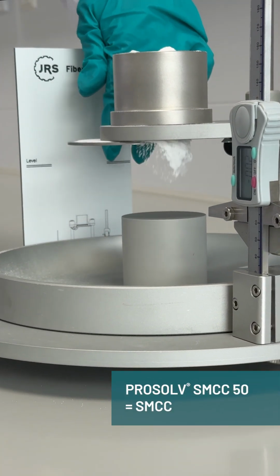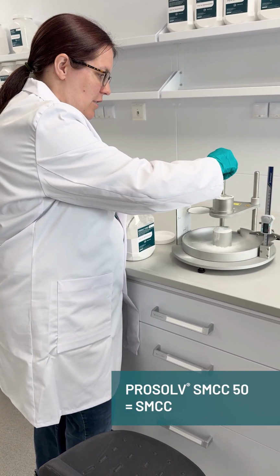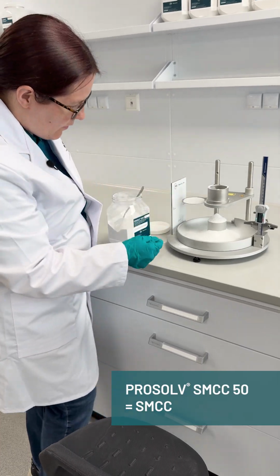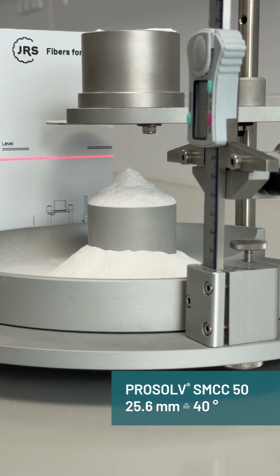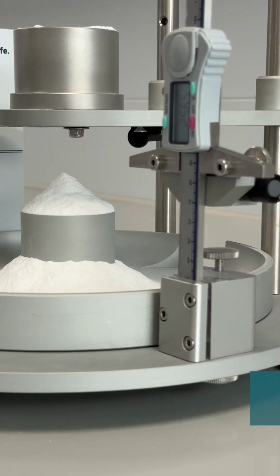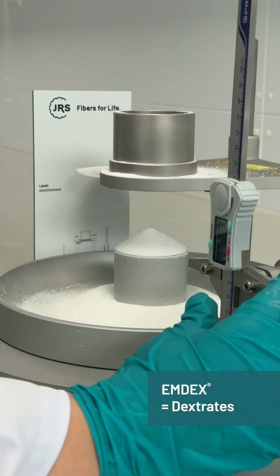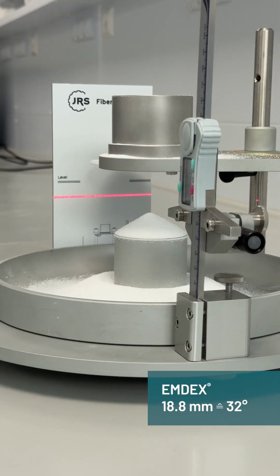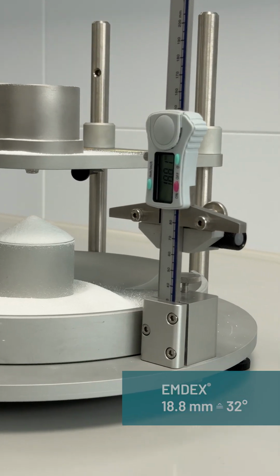And let the powder fall. Now in this case, I'm actually going to stir it to ensure that the powder can make as big of a cone as it can. All right, now I'm expecting a much higher angle, 25.6 millimeters. So indeed, a higher angle for this less flowable powder. And here we have a measurement of only 18.8 millimeters, which corresponds to an angle of 32 degrees.